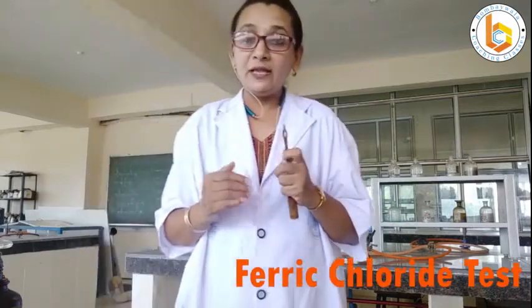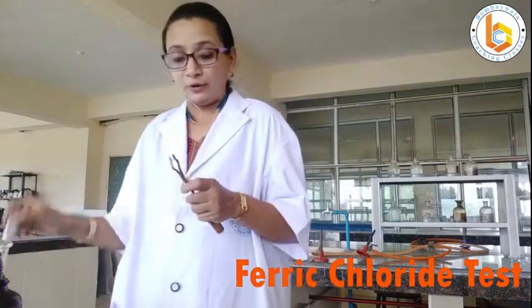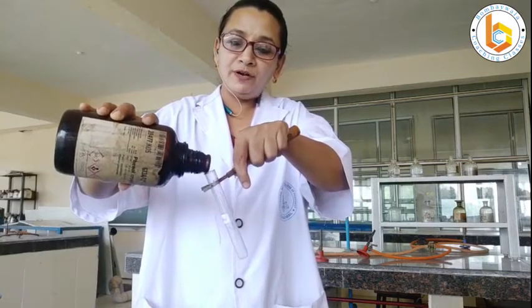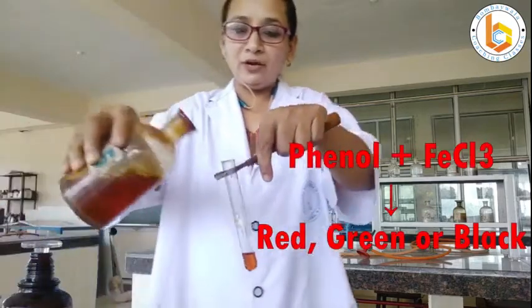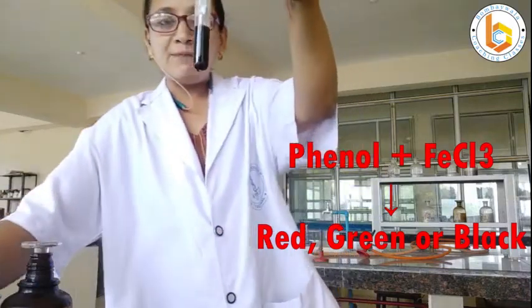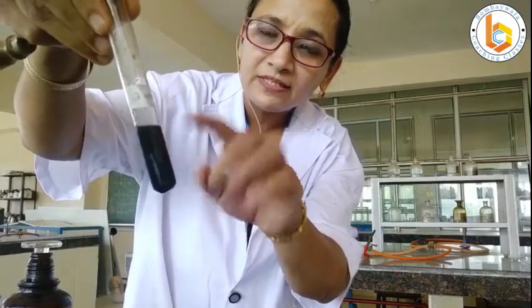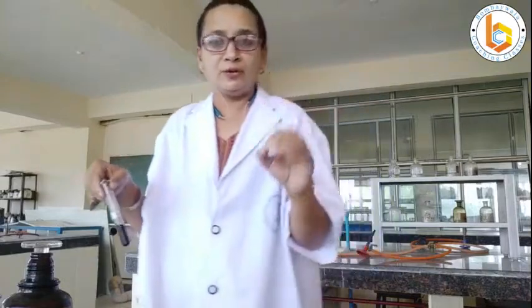Now let us move on to the second test for phenols — the ferric chloride test. This is a classic and most important test for phenol. Simply take a small quantity of phenol and add ferric chloride. See this color reaction — you can get a red, green, or black color. It appears as a greenish-black color here. The color may vary, but such a color reaction is a characteristic test for phenols. This dark green to black color is how phenol reacts with ferric chloride.